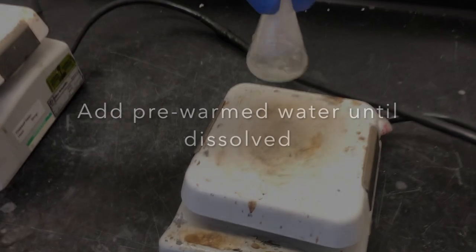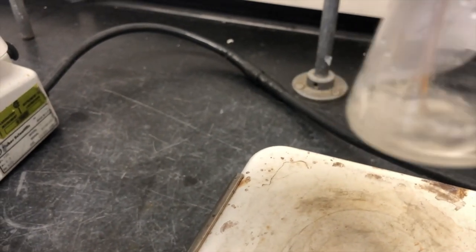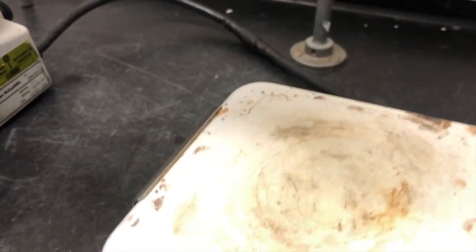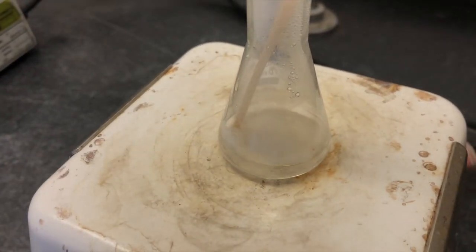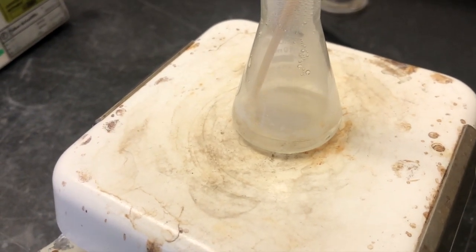With a boiling stick added we can now bring the solution to a boil and add pre-warmed water until it just dissolves at a slow boil. We continue to check if the solid has dissolved yet and add water slowly in small increments to make sure that it dissolves just at the boiling point. It appears there is a little solid left so we will continue to heat it and add water slowly. After each addition of water we carefully bring the solution back to a boil again.